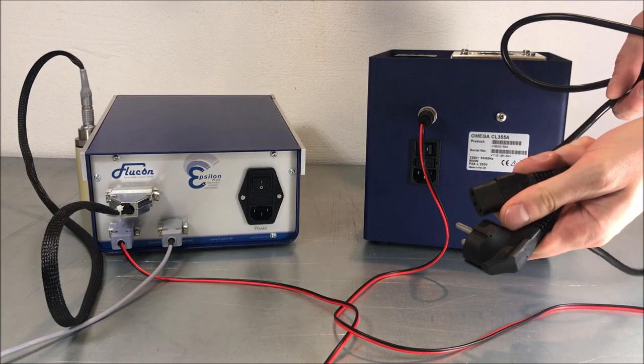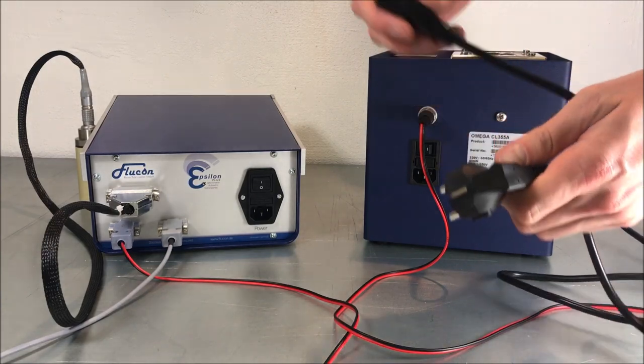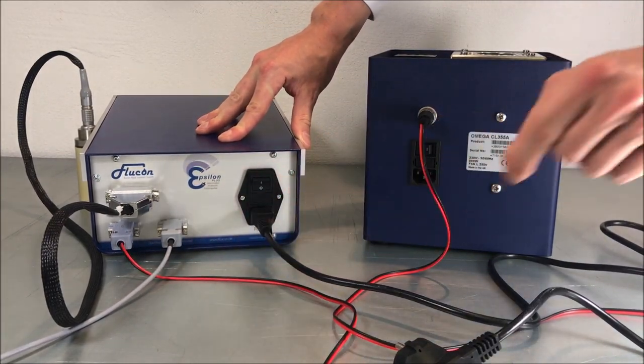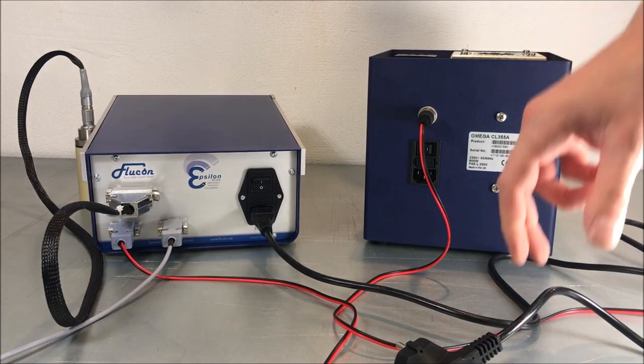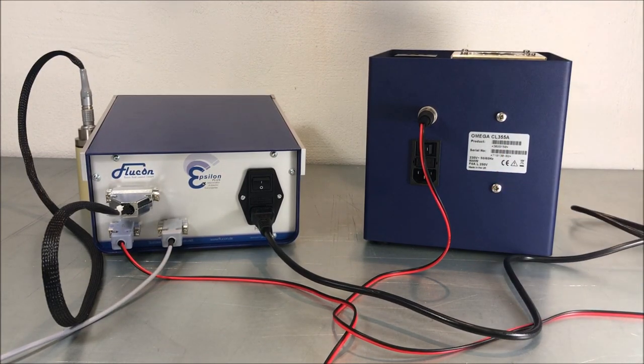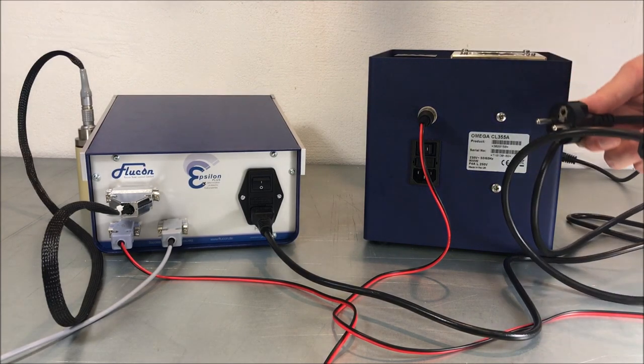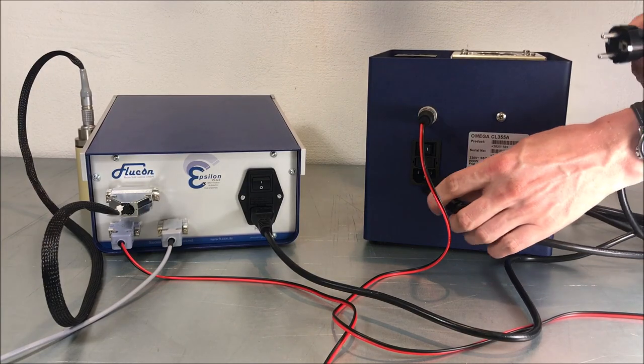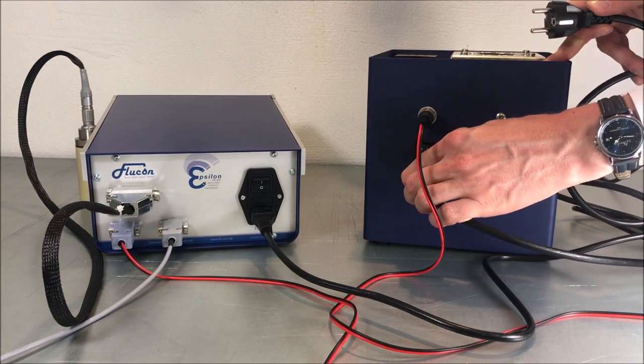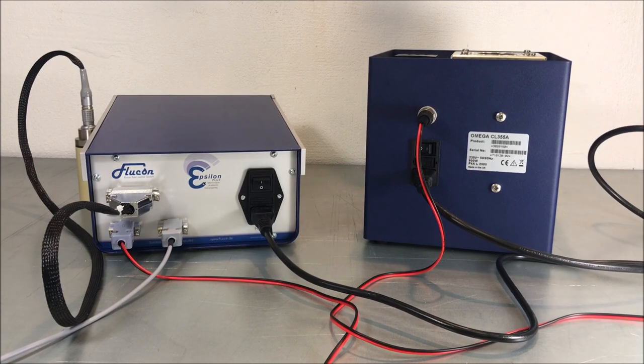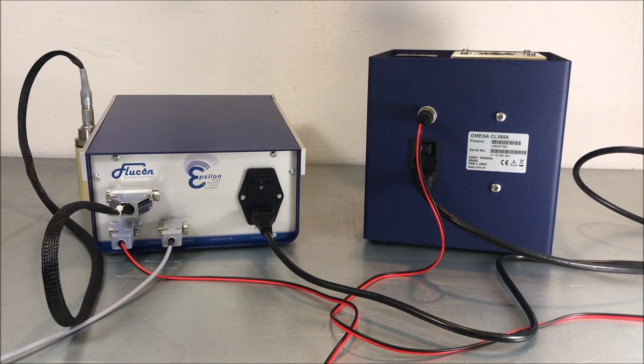Finally, use the first mains cable for power supply of your Epsilon Plus and the second cable to plug into your thermostat. Now your devices are ready to be switched on.